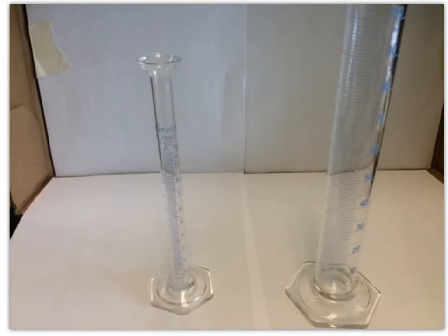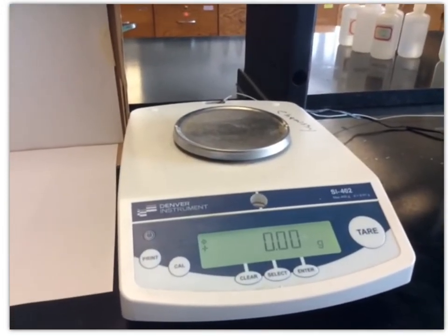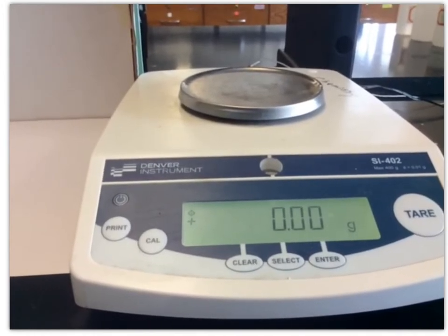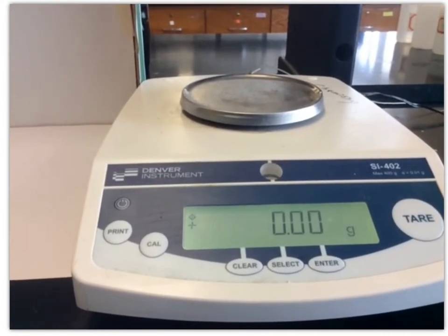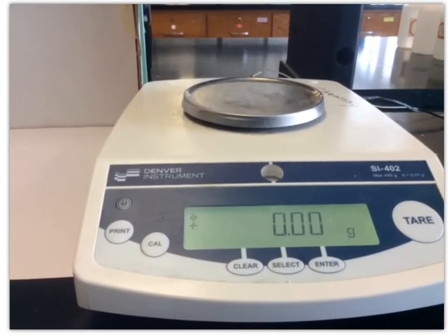Now, I also said we're going to be measuring masses. Mass is going to be much easier for us to measure because we conveniently have a digital balance. We actually have several in the lab, but this is the one that I will be using. And what you should notice here is on that screen you see 0.00. That's because it's been zeroed or tared, and there's nothing on that scale. Once I put something on there, that number is going to obviously change. But it shows right now 0.00, showing you that the readings are going to have 2 decimal places.